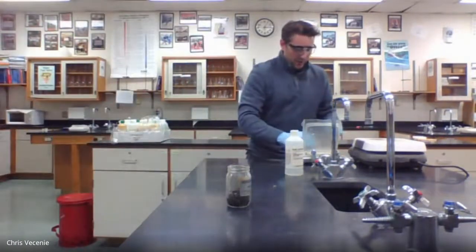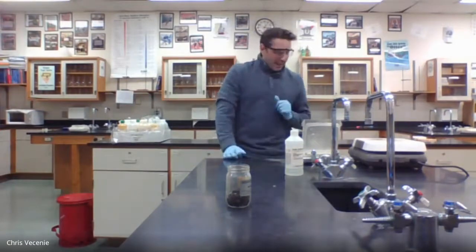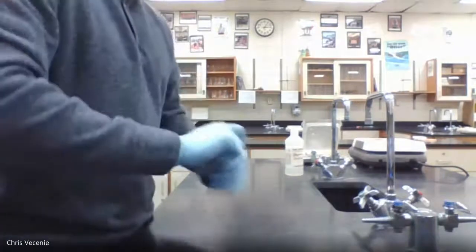Now I'm going to get the mass of this with the manganese in it. That is reading 53.67.